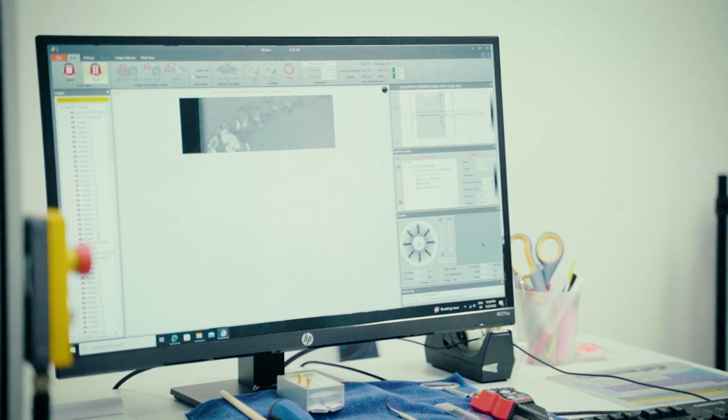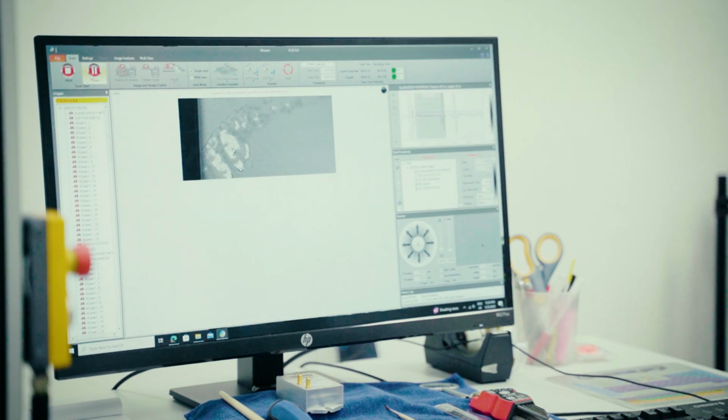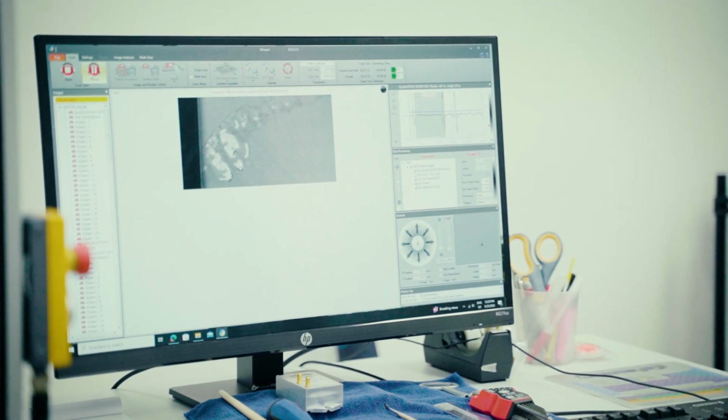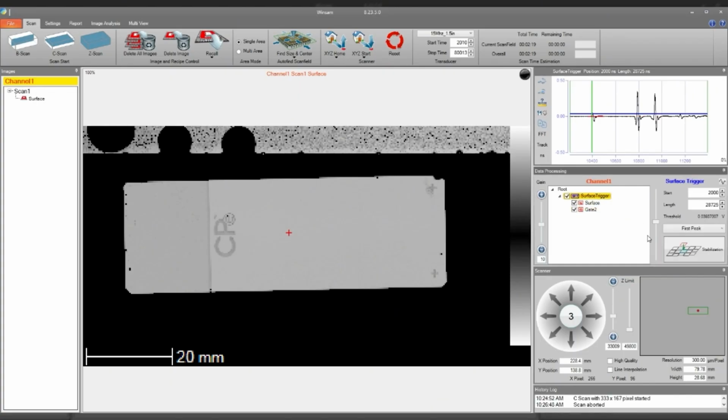Now we can see during the scan, the surface echo and bond interface echo. It's the bond interface echo where we can see voids. Here we can see these bright regions, these are the voids. And everywhere else where that's dark is well-bonded material. Here we can see an image of the surface echo. So the surface echo is showing just the top surface of the part.